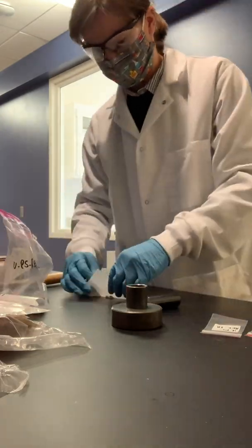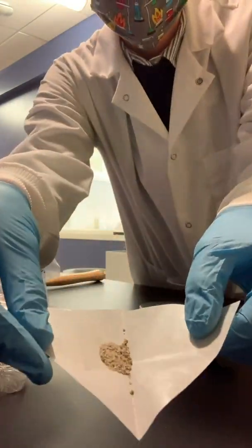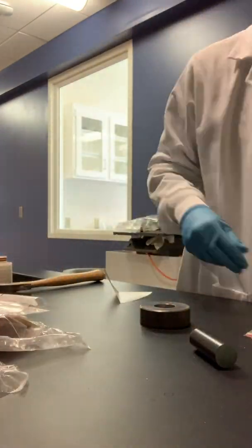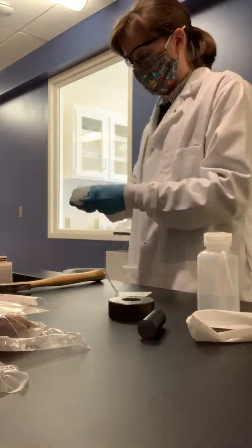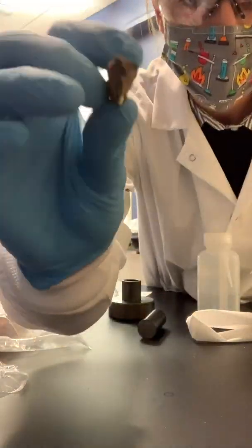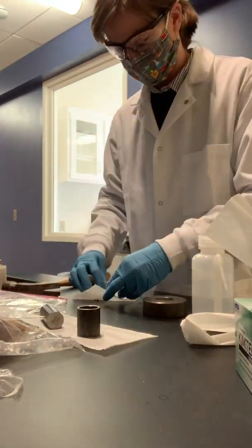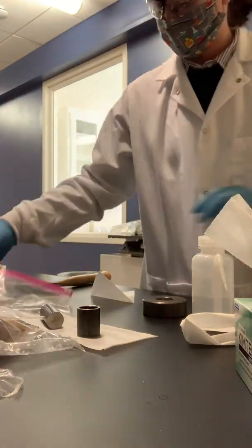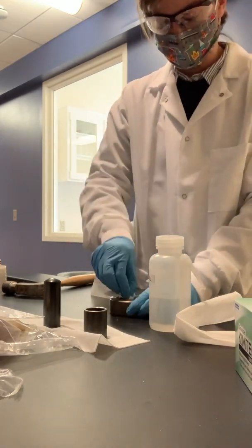Today I'm going to take you through a day in the life of a lab trace metal geochemist. So the first step with any sample is to take it and break it down into smaller and smaller pieces. This helps increase the surface area so we can go from a solid rock into something that's a solution. You can see me doing that here with what we call a mortar and pestle, where I take the sample, place it in this metal container and then smash it with a hammer. You'll also see a lot of cleaning in between, because we're worried about contamination between samples, but also from things that may be falling out of the air.